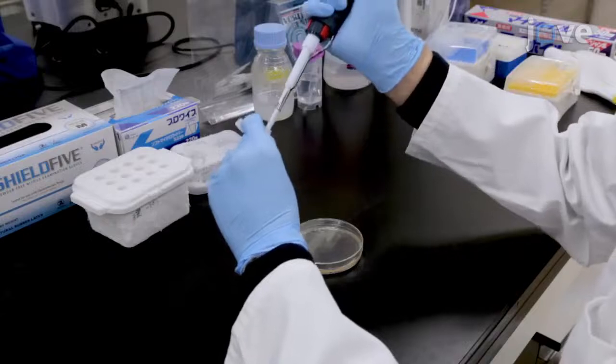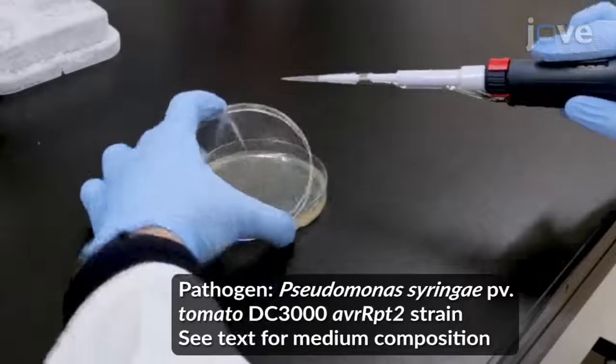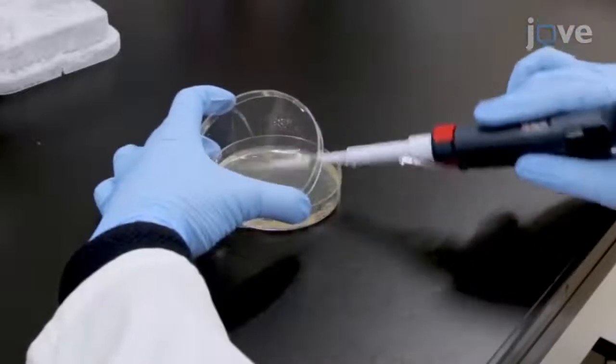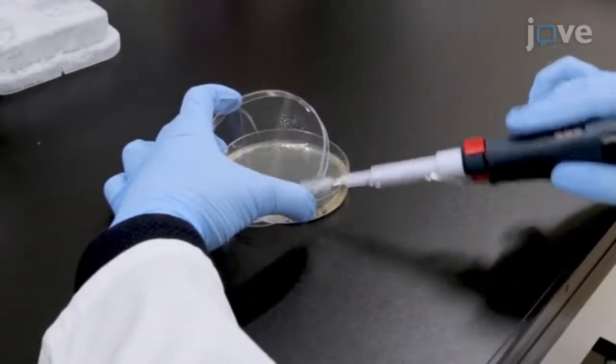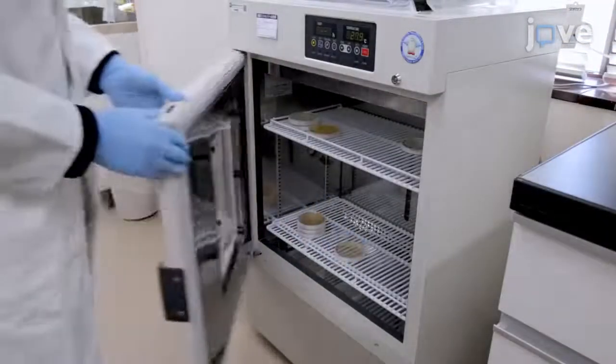2 days prior to pathogen inoculation, streak the pathogen carrying AVR-RPT2 from a glycerol stock onto NYG medium that contains rifampicin at 100 mg per liter and kanamycin at 50 mg per liter. Incubate at 28 degrees Celsius for 48 hours.